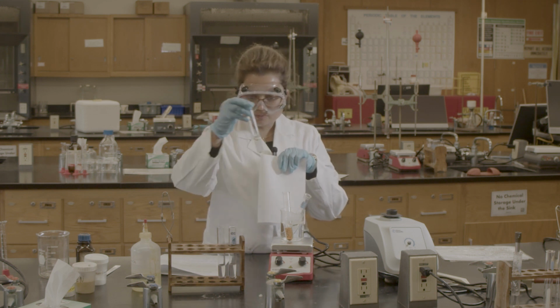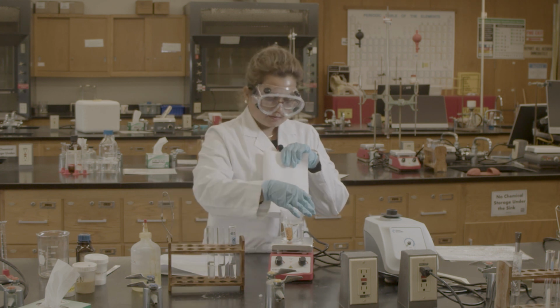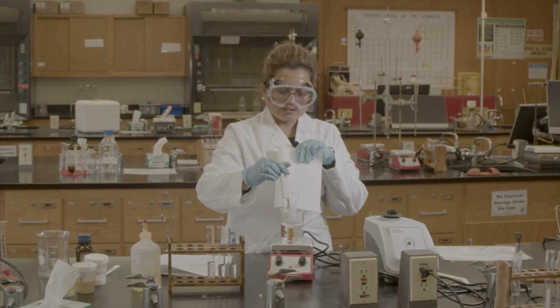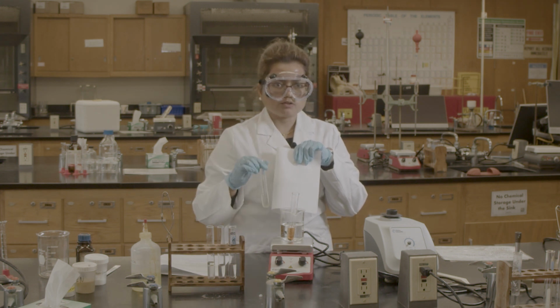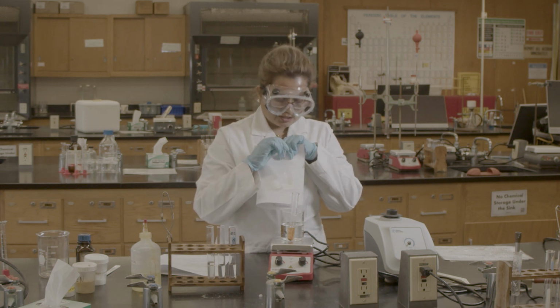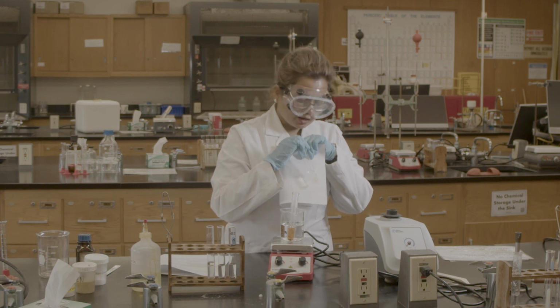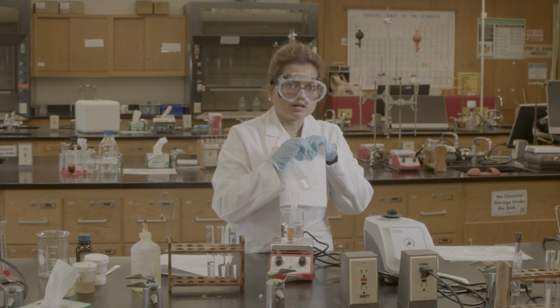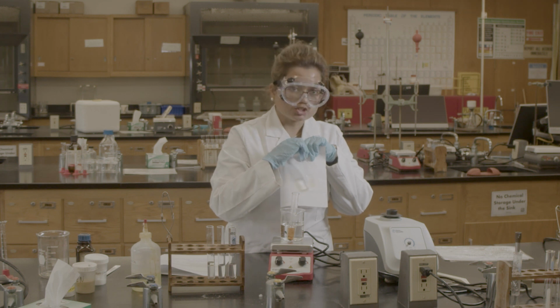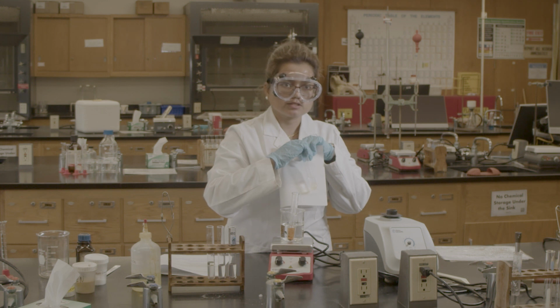Next one, I said that gelatin is a combination of polar and non-polar. Check, it maybe reaches the melting point, that's why it dissolves in our hot water. So in the hot water bath, the gelatin dissolves.